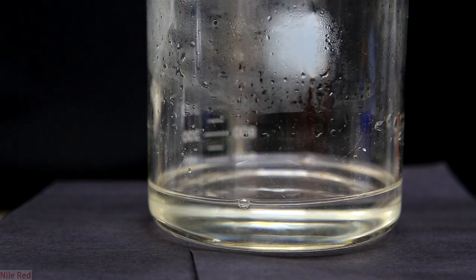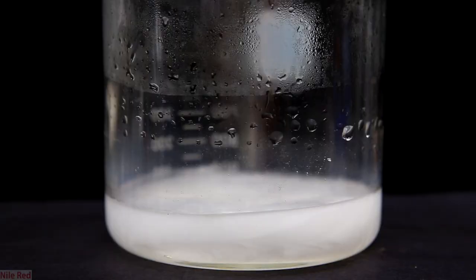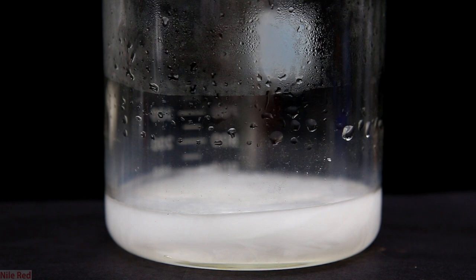After something like 30 minutes at 120°C, I took it off and let it cool. When it's still hot, I can swirl the beaker around and you can see it's still quite liquidy. But eventually, as it cools, the ammonium formate will crystallize.